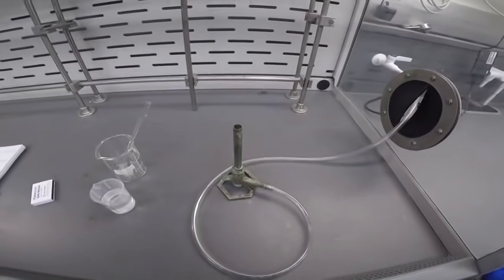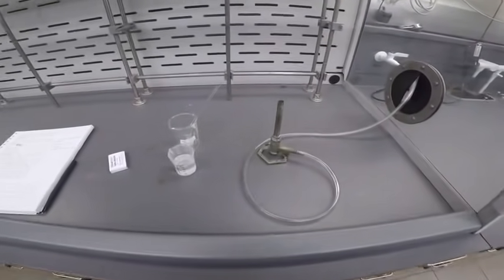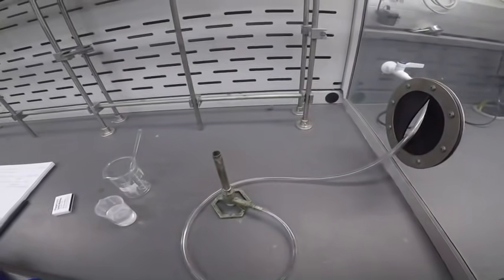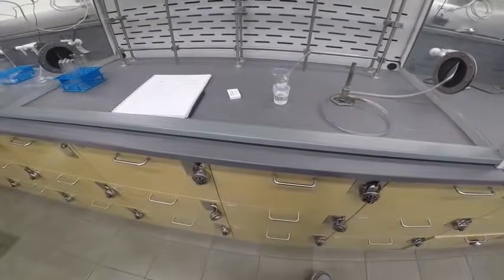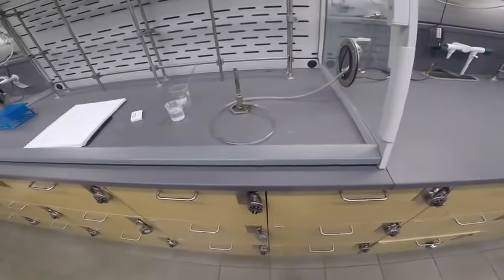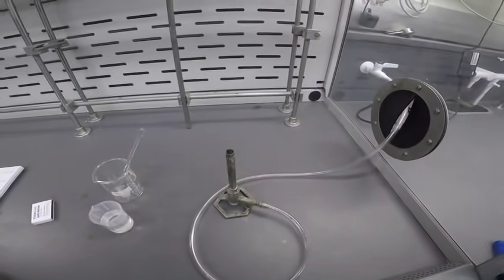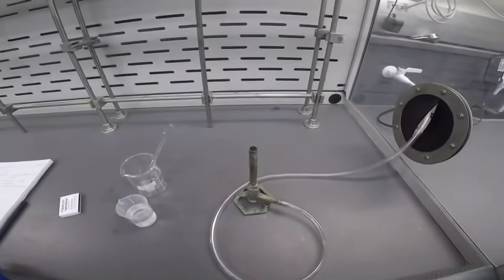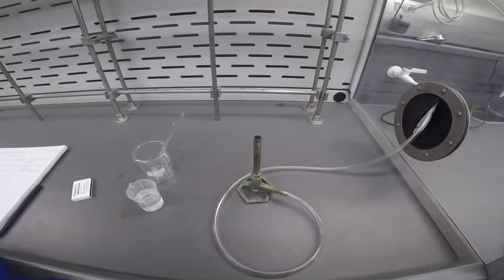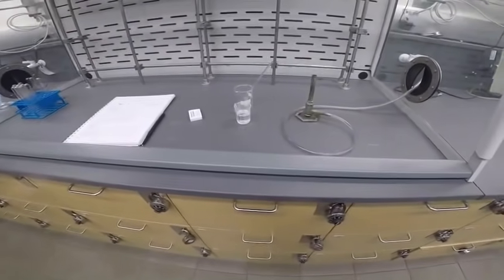You also hopefully have gone through and written some net ionic equations for those reactions and started to associate them with different observations. And then another thing you want to do before tackling this part is think of unique tests to test for 4 cations that we're going to look for in an unknown mixture. Those ions are sodium plus, magnesium 2 plus, strontium 2 plus, and NH4 plus, the ammonium ion.